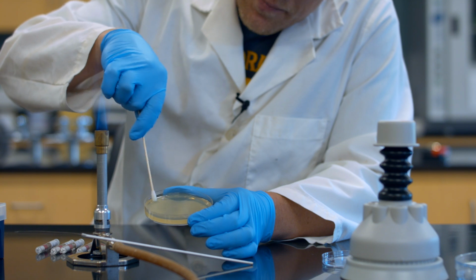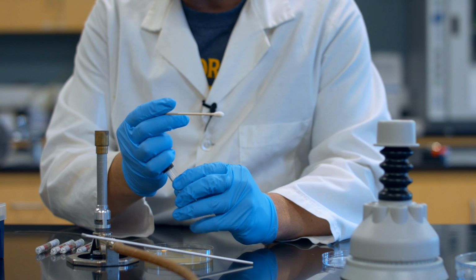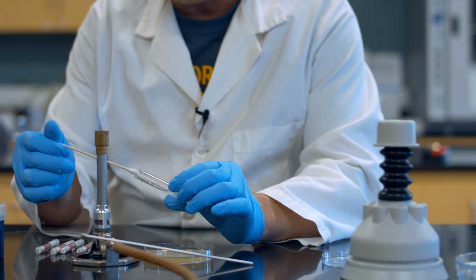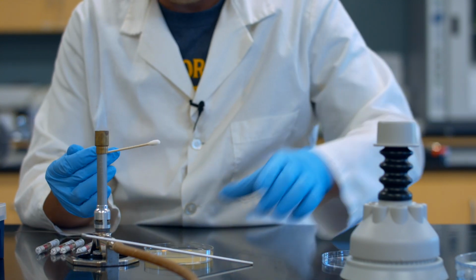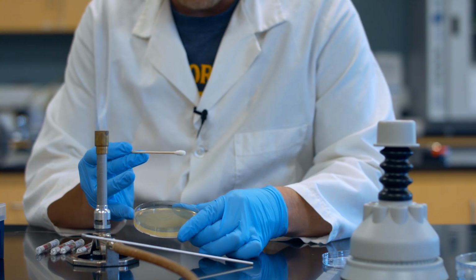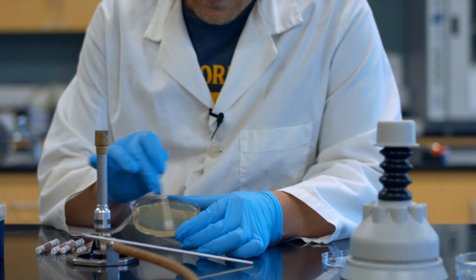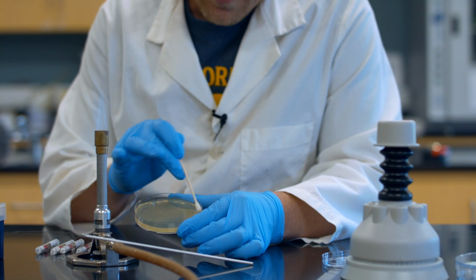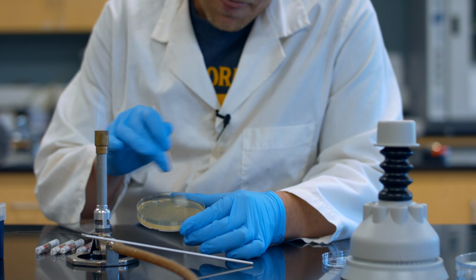You will regret gaps. And then we're going to do it a third time, and we're going to go 45 degrees. So these lines will be 45 degrees to both of the other two sets of lines. Doing all this work in the safety zone of the flame. I'm going to look at this, get it lined up. I can see in the reflection the two perpendicular sets of lines that I just did. And now I'm going to do a third set. Overlapping very carefully. Like I said, imagine it's red paint and you don't want to see anything underneath. You're trying to really thoroughly cover it.